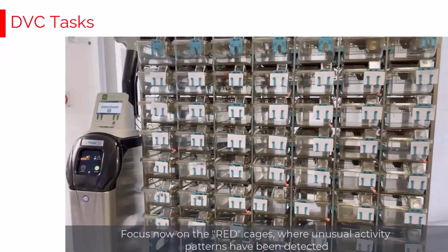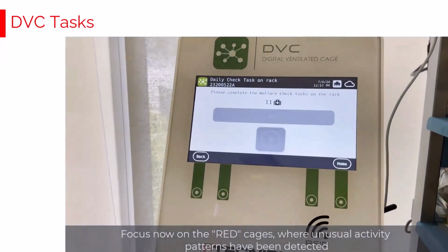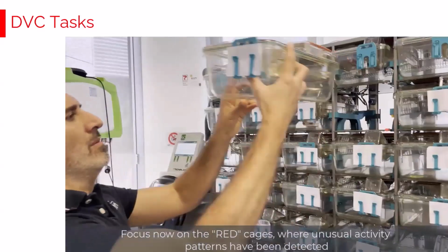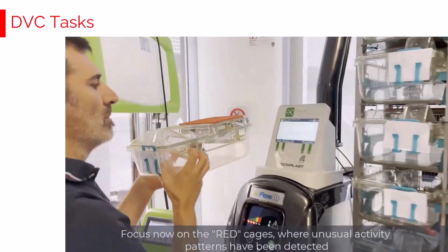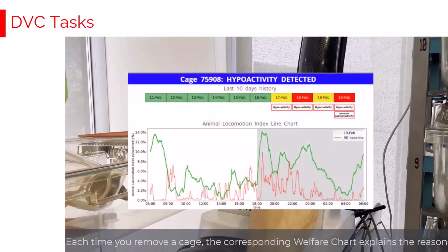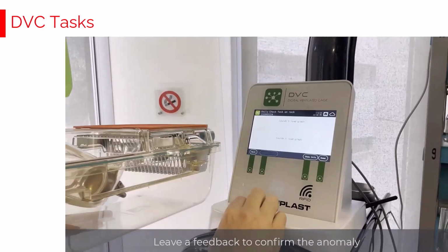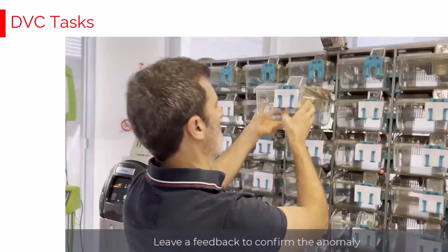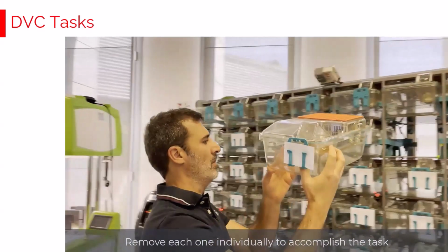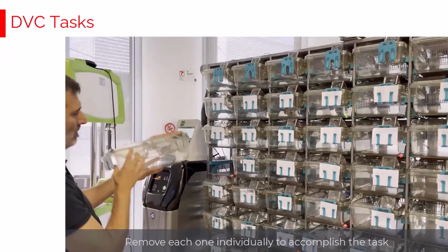Now, as said, only the red cages, illuminated in red, are remaining and must be physically removed from the rack to accomplish the task. It's now time to physically remove one by one and deeply inspect these cages, because during the night something has been detected. In this interface, you will see a real graph, as well as, by clicking the button, the content of the cage, and you can also leave feedback in case it corresponds to a real anomaly you can also discover in the animals. The task is accomplished by physically removing the cage from the rack and deeply inspecting.